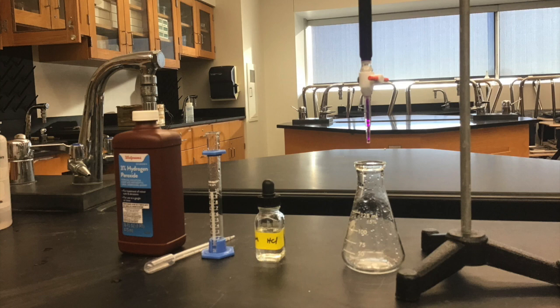You're looking at the supplies for this lab. In the burette you'll see a purple liquid — that's the potassium permanganate. The important part of the potassium permanganate is the permanganate ion. The manganese in permanganate is going to reduce in this chemical reaction. The other substance that we're going to mix together is hydrogen peroxide, and the oxygen in hydrogen peroxide is going to get oxidized.